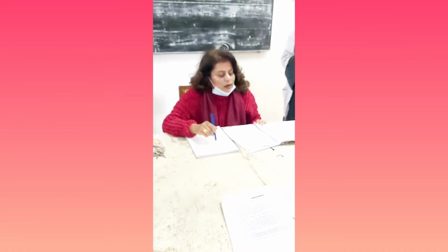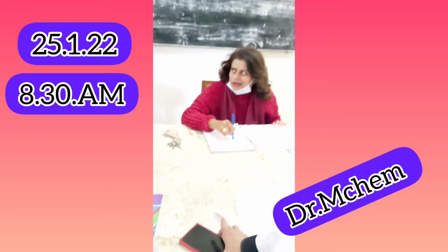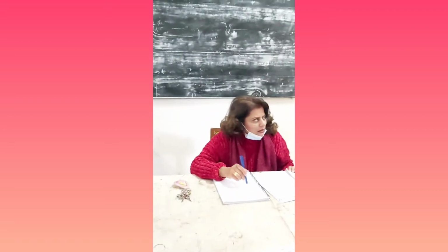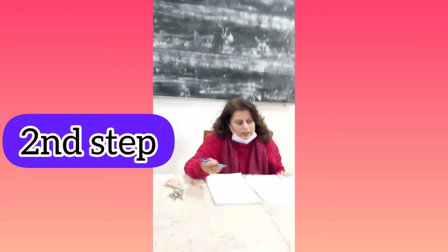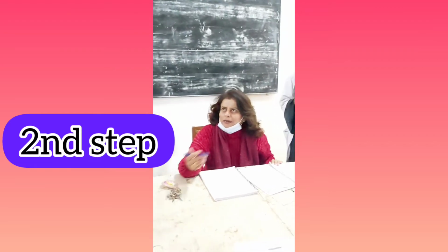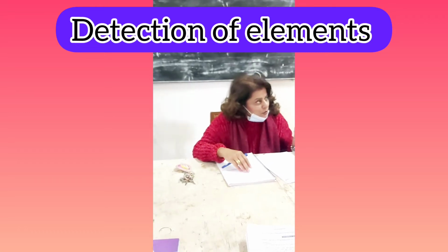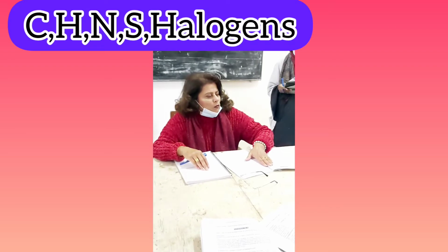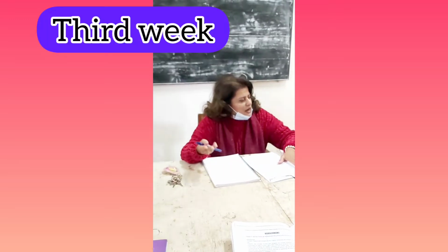Okay. So today we are going to start step number 2 of the same compound whose first step we have done last week. That is, you have done the preliminary examination, as I have explained many times, that every compound will be identified by 4 steps. That is preliminary examination. Number 2 is detection of elements, which is today's work. Then the third step is classification, and fourth is melting and boiling point. It depends upon the nature or state of the compound.